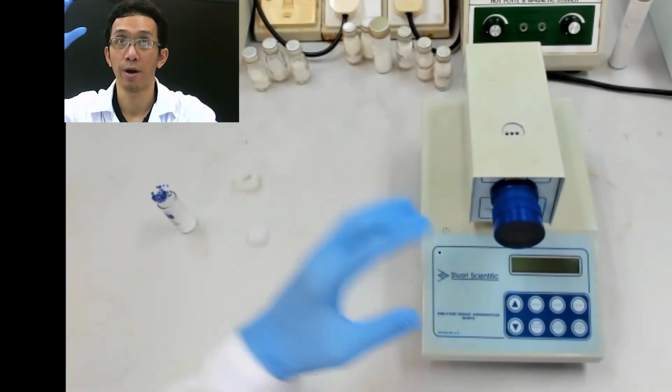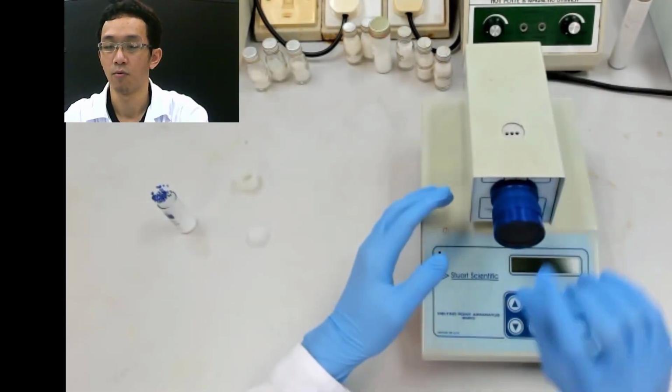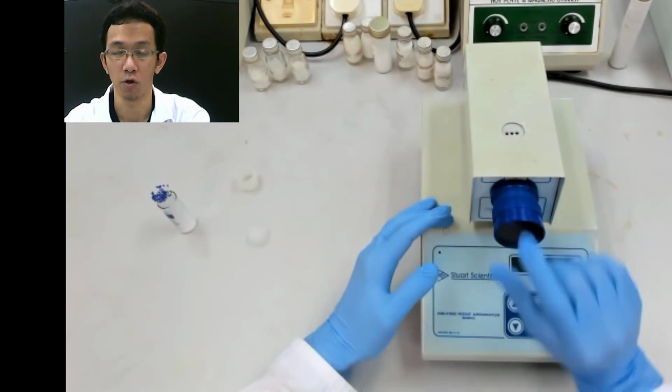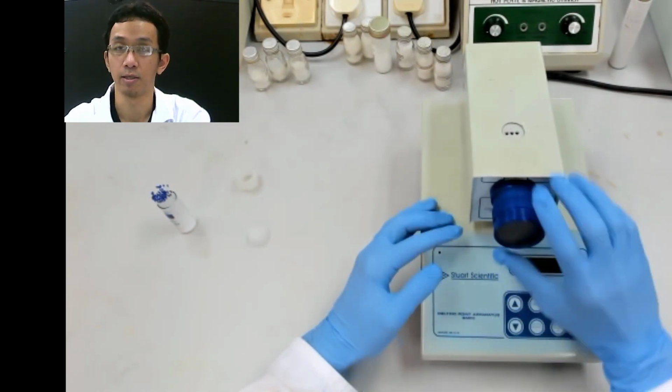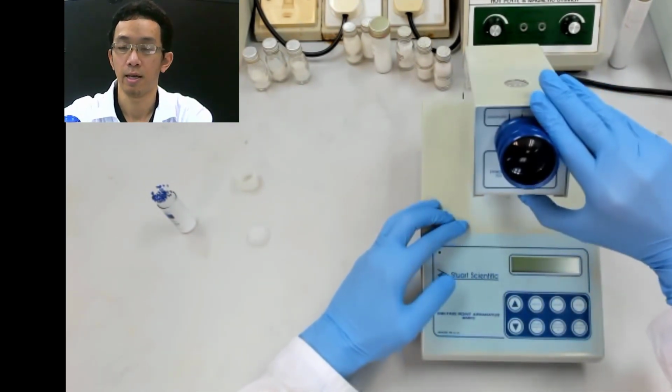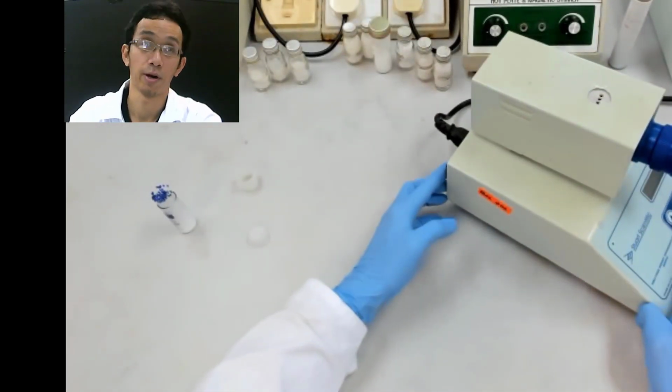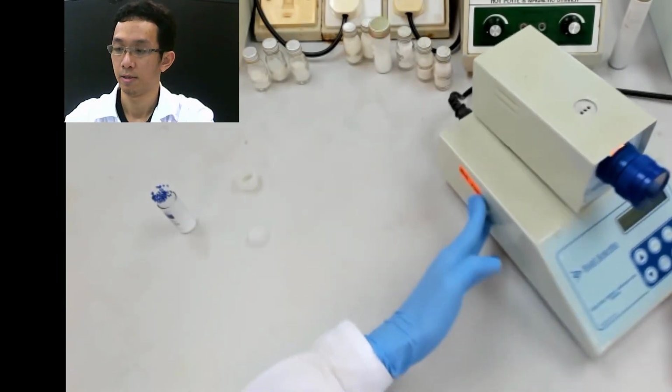And also whatever camera that is seeing this now, I will zoom on this eyepiece, because your task is to see from this. Okay, so let me open first. At the back of this there is a switch, so you just open.